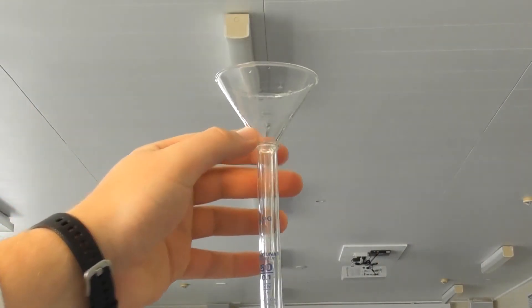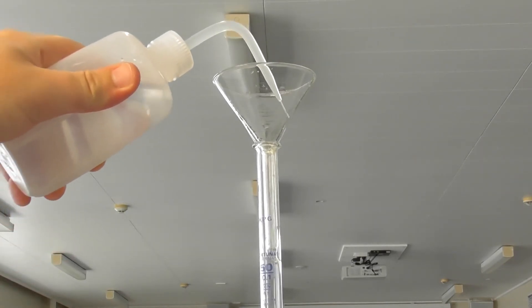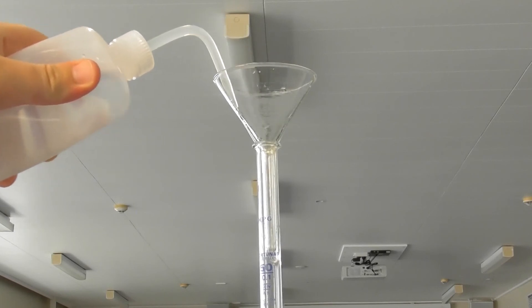Burettes also need to be carefully rinsed before use. Rinse first with distilled water, then rinse a few times with a small volume of the stock solution.